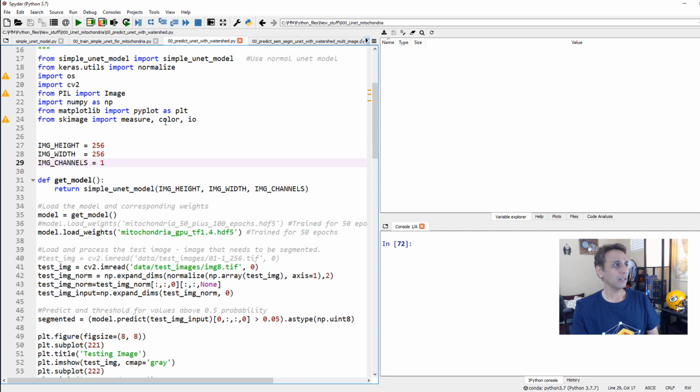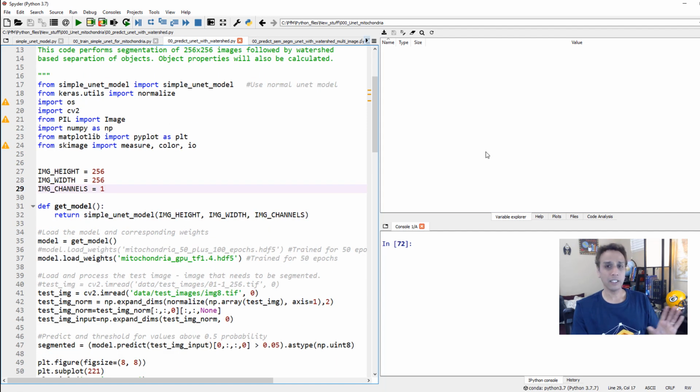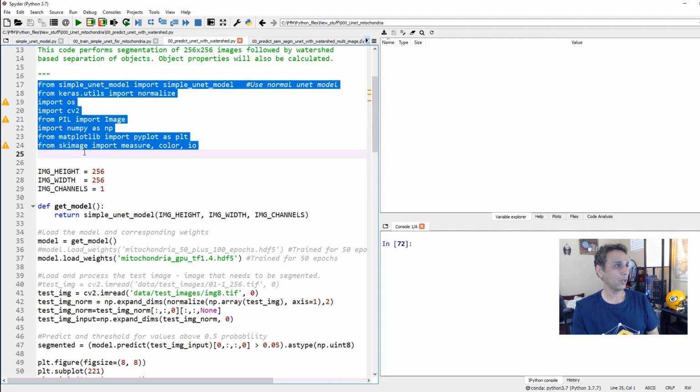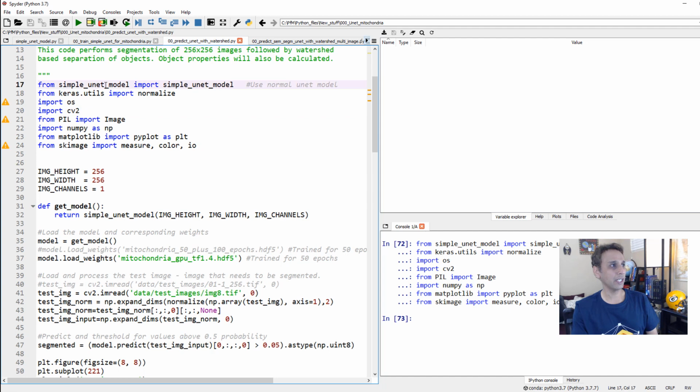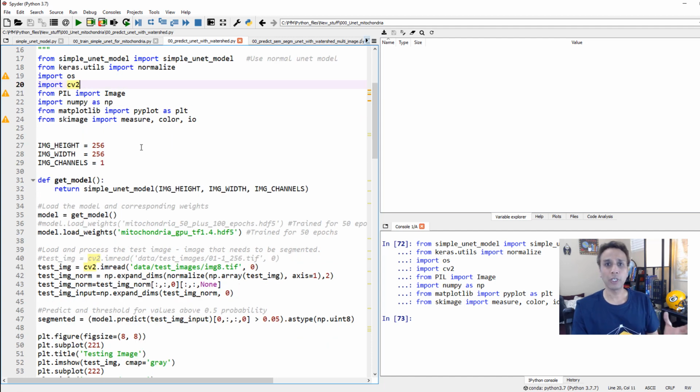What is it? Well, let's start with a clean slate, and let's go ahead and load the libraries that we need. Most of these you should already know. The first line is basically loading the model. We are going to normalize our data, and OS, CV2, and all of these you should definitely know. And the next thing is just importing the model.